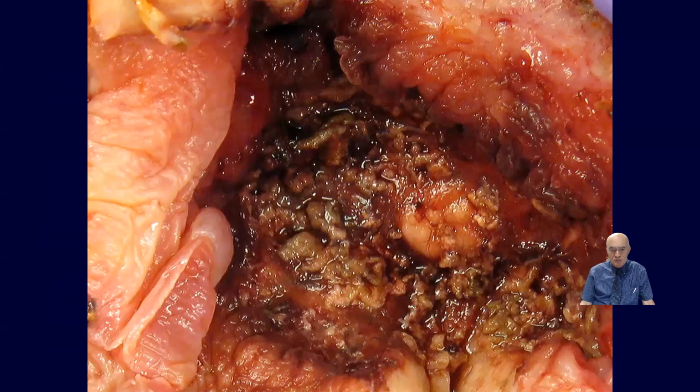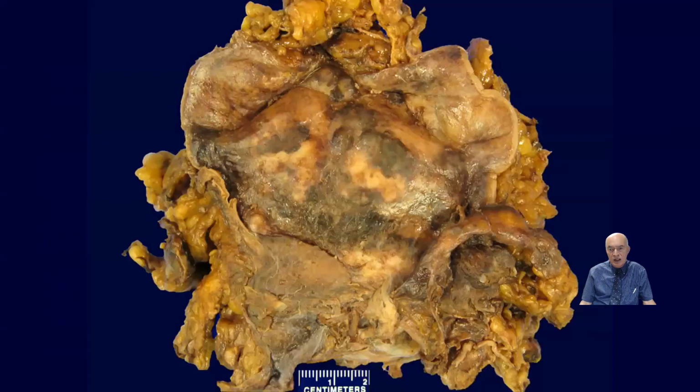meticulously. Again, more details of this papillary tumor with these areas of extension. And then this is another tumor with a little bit of a weird dissection. This is very regular, but you can see here some suspicious areas. Sometimes when these patients have had a previous TURP and removal of the tumor, we're going to find the ulcerative lesions or the scar lesions that look very suspicious as well.